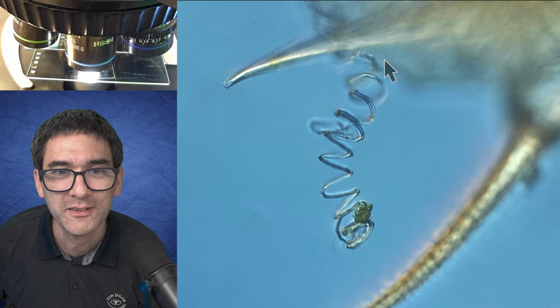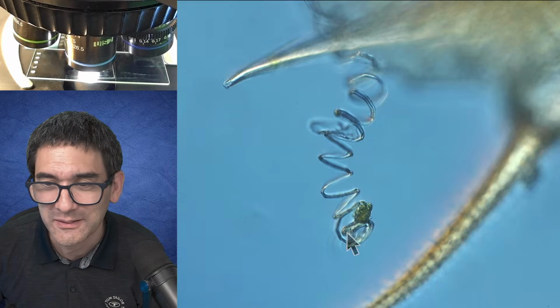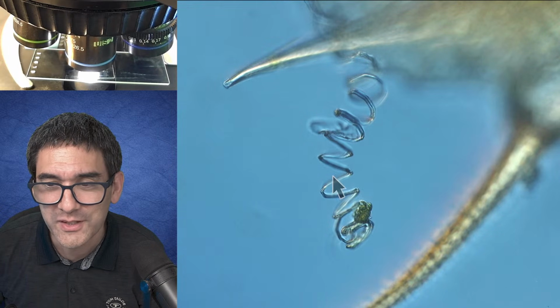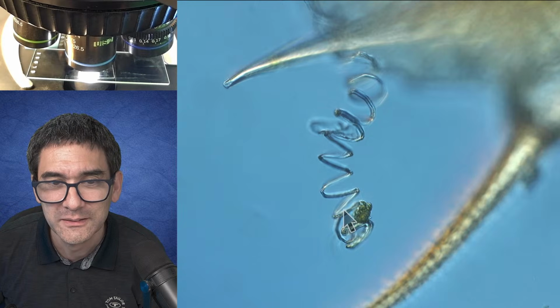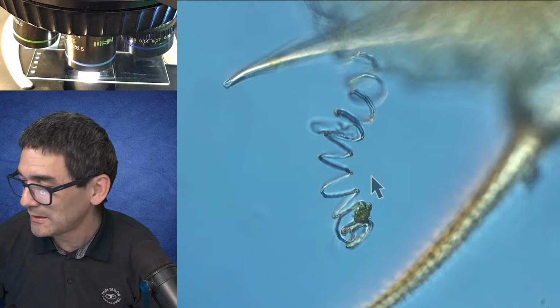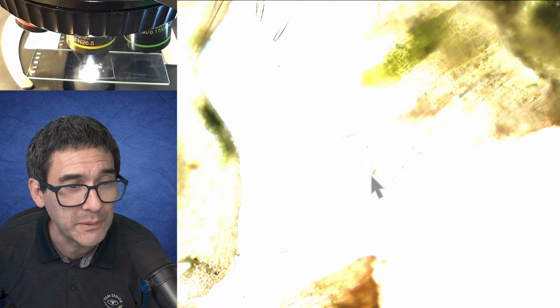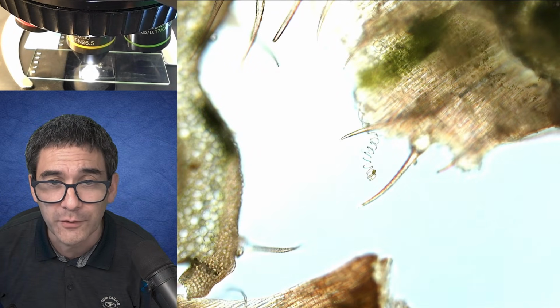Look at this. This here, that's of course xylem, right? Yeah, that's of course xylem. So, let's talk a little bit about this monocot dicot thingy. You see, the two types of flowering plants are either the monocotyledons or the dicotyledons. The cotyledons are the first leaves that are formed.